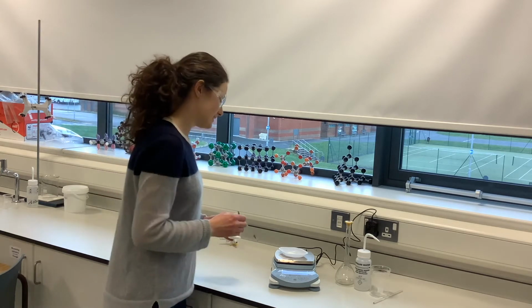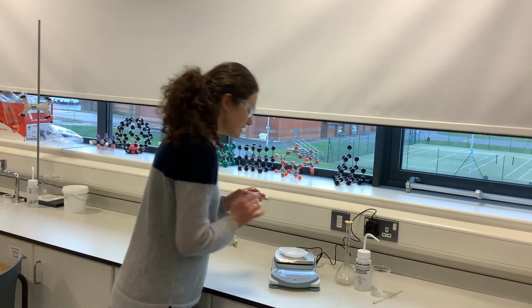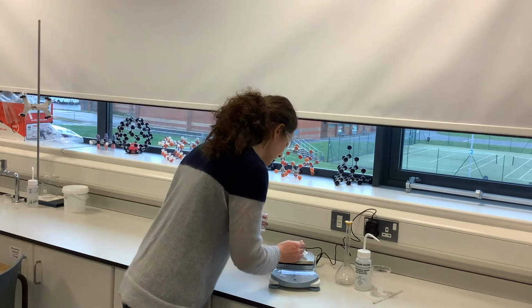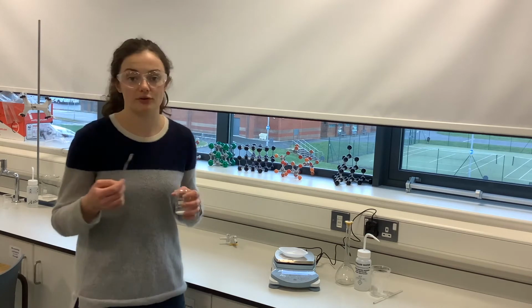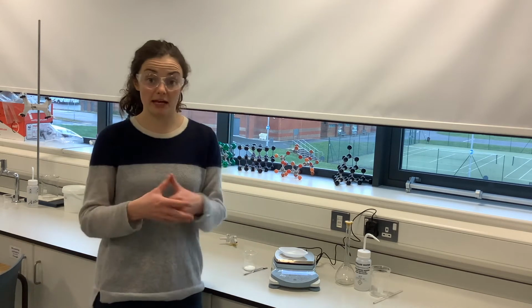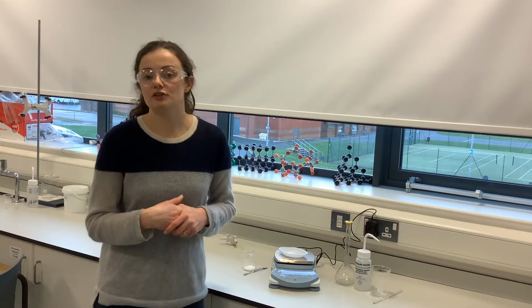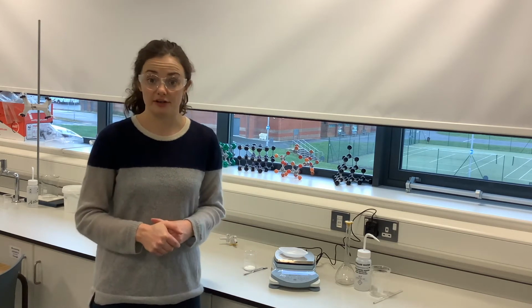So that's the first stage, although now it's gone up to 2.87. Sometimes even with a little bit of movement of air past this, it can change mass. So we'll take a tiny wee bit out. And that's us back on 2.86 grams now. So I know I've got the exact mass that's measured out. So that's the first step, measure out accurately your known mass of your salt, because we want to know how much salt we're putting in our solution in the first place.